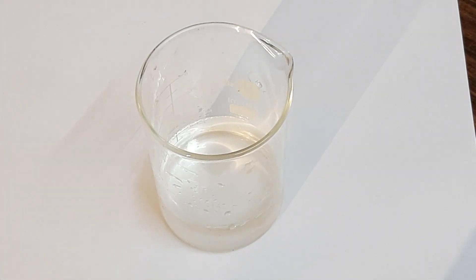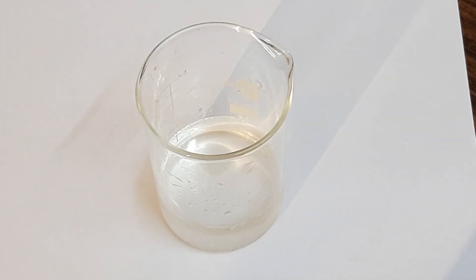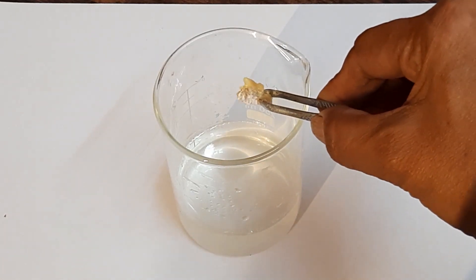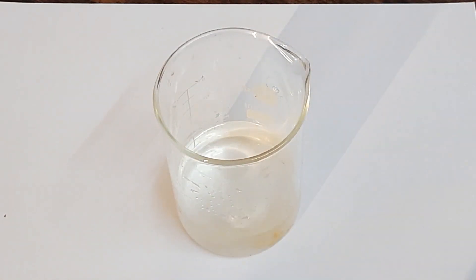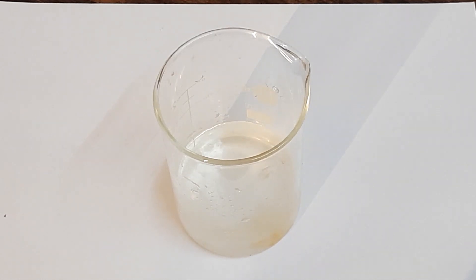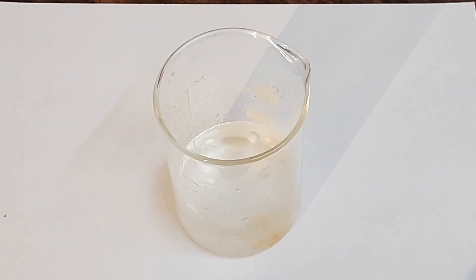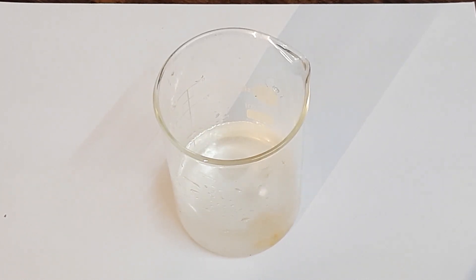Now you can see this beaker containing water. I am taking this sodium piece and I am going to drop it in. Watch that — it is reacting with water and it is releasing hydrogen gas.